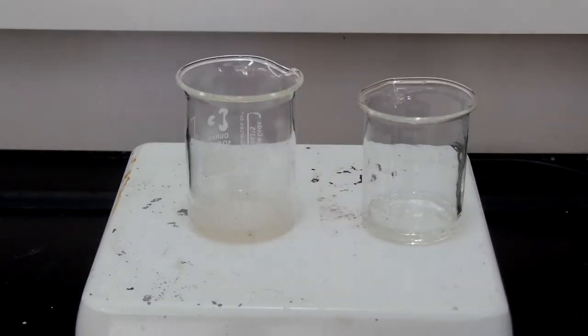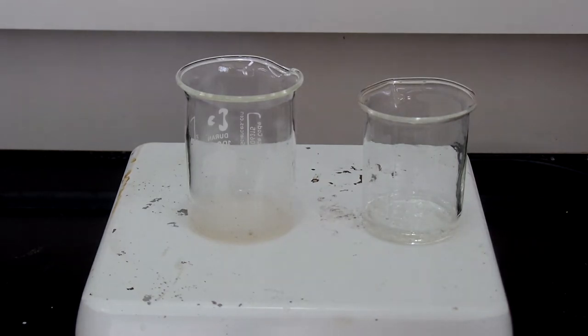I'm currently mixing sulfuric acid with silica gel. This is to make silica sulfuric acid and to use it as the catalyst for esterification reaction.